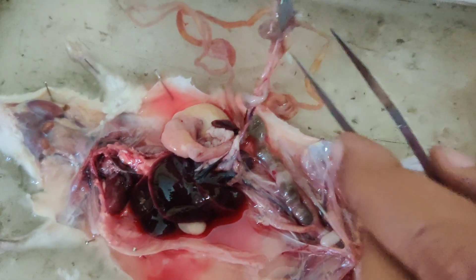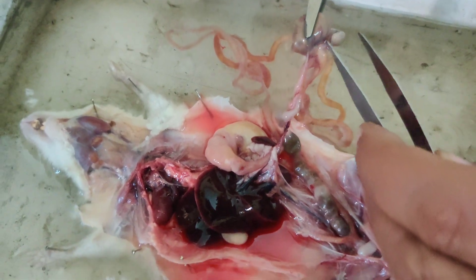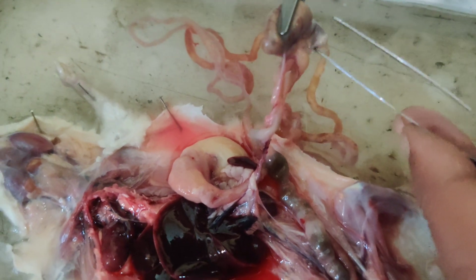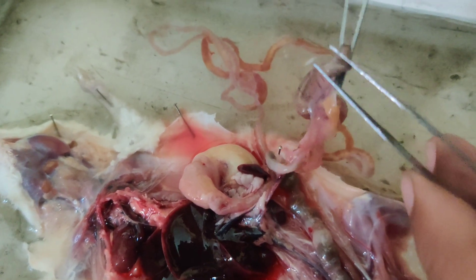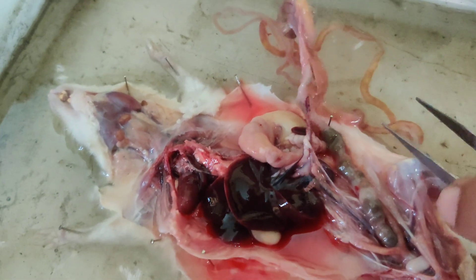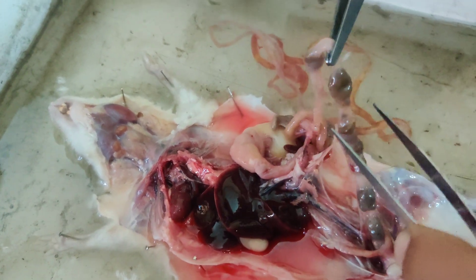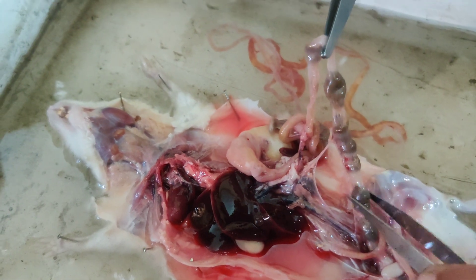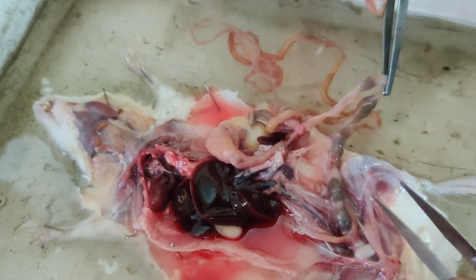This structure is the cecum, which is part of the large intestine. At the terminal part of the cecum you can see this curved structure — this is the appendix, attached to the cecum. Then this is the rectum. In the rectum you can see the feces — undigested waste — these rounded structures at different intervals.